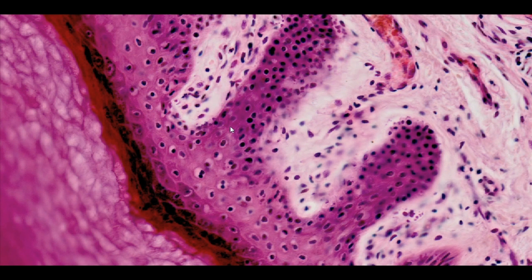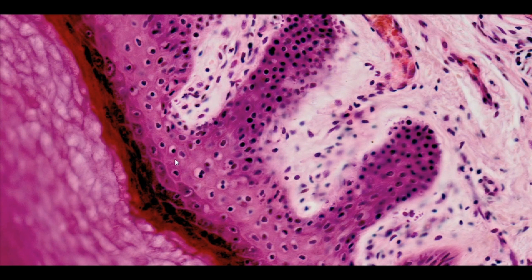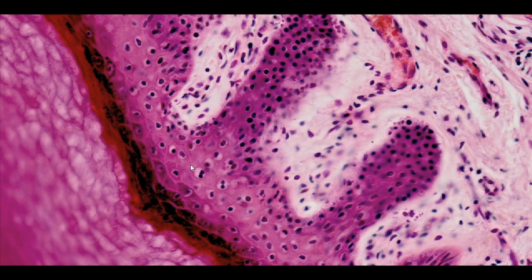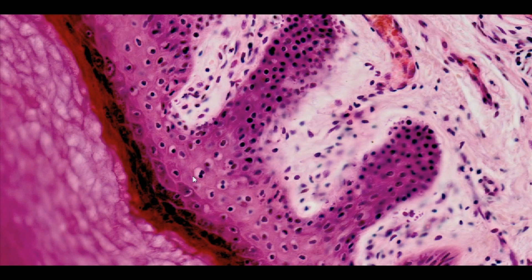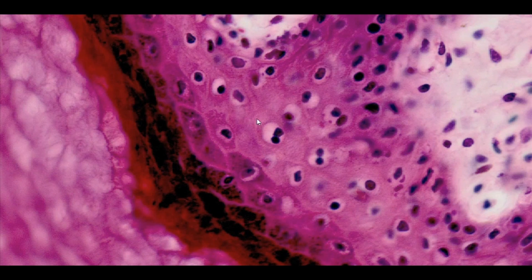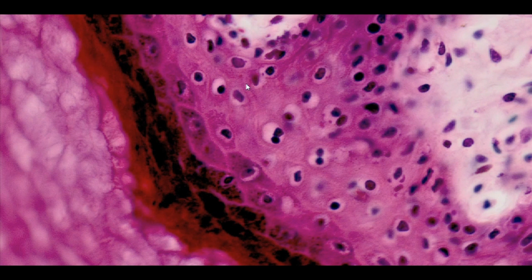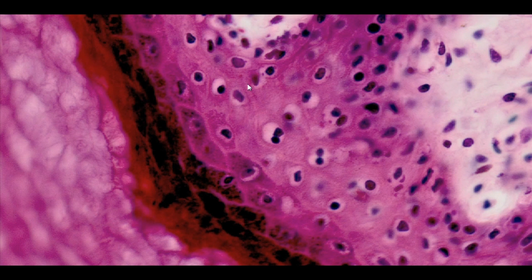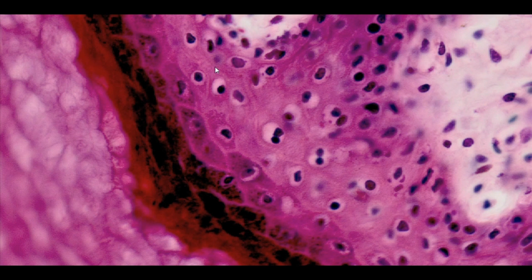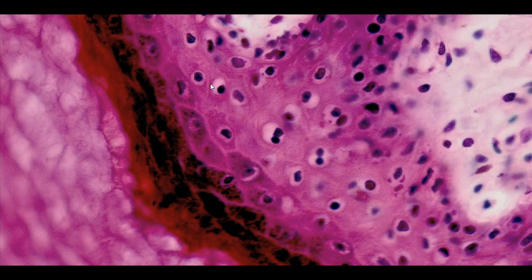The next epidermal layer is formed by polygonal cells, which are metabolically active and produce proteins such as keratin and involucrin. These proteins will be involved in the formation of the horny layer in the stratum corneum. The keratinocytes of the stratum spinosum are connected by desmosomes, which are visible in the specimen in the form of spike-like processes, which appeared as a result of shrinking cytoplasm of these cells, and from which the layer was named.